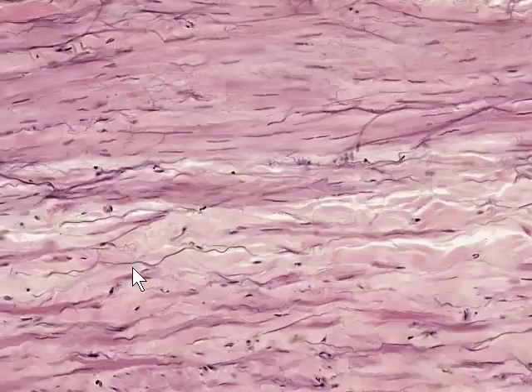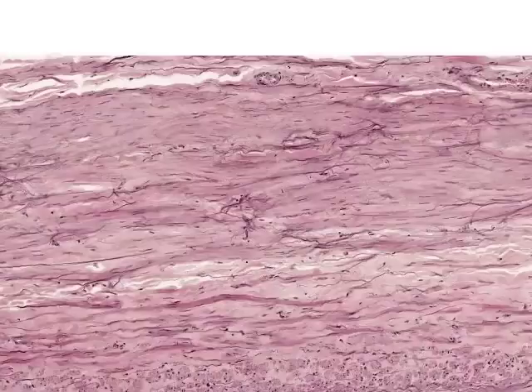And there are a small number of elastic fibers, generally thin, sometimes branched, that are found in the tunica media, and you can compare this with the disposition and size of the elastic fibers or elastic lamellae that are found between the smooth muscle cells in the aorta in the tunica media.